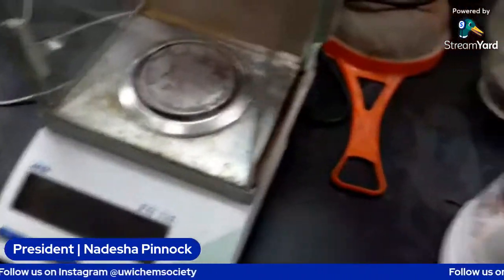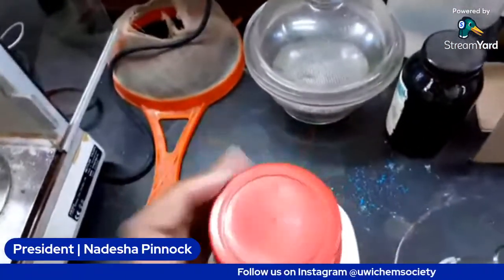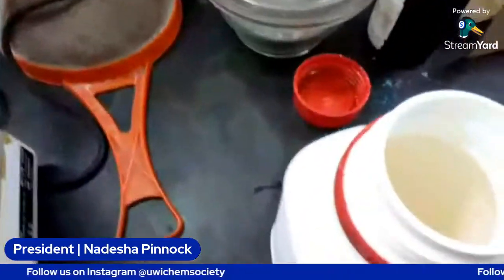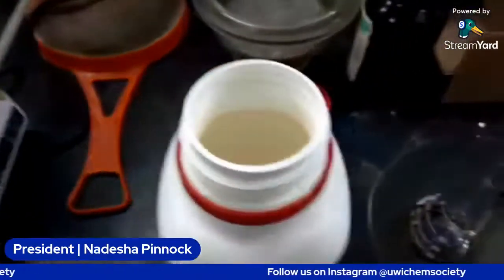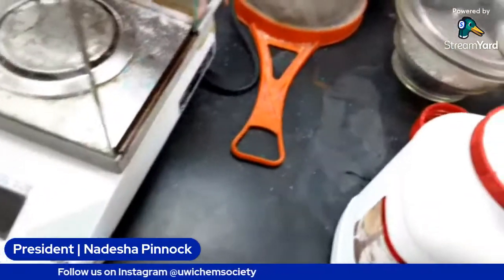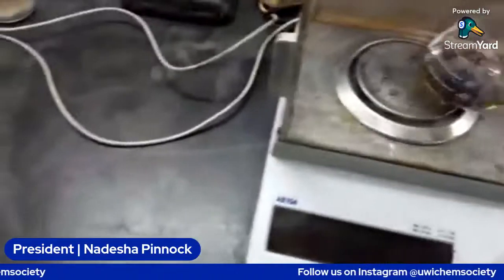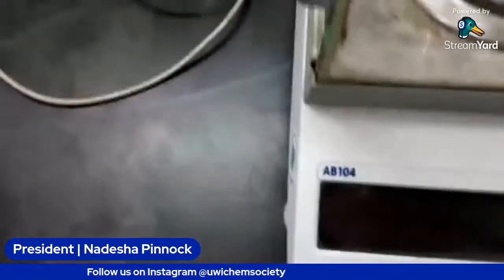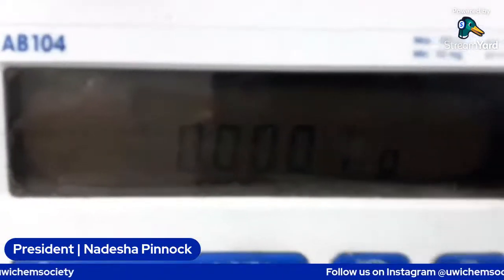And then we're going to do potassium iodide. So it's a 10% potassium iodide, which means 10 grams in 100 ml of water, which I'm just going to use 5 grams. I'm going to add it to the same conical flask. So I'll just add it back to the analytical balance and zero the balance. There we go.